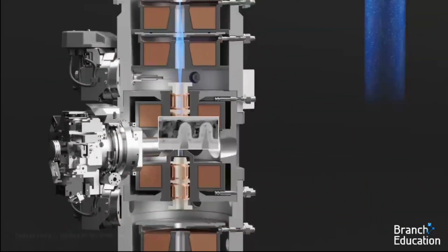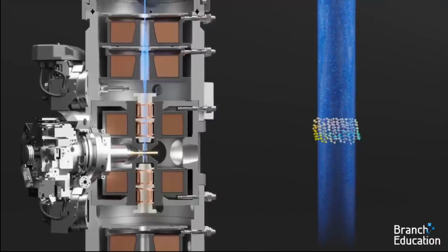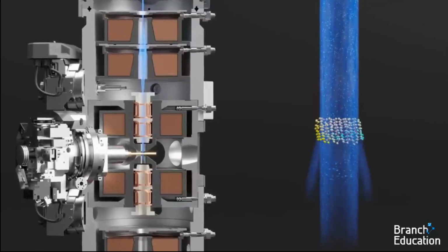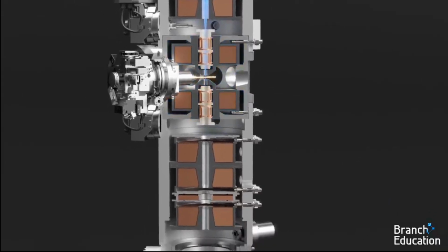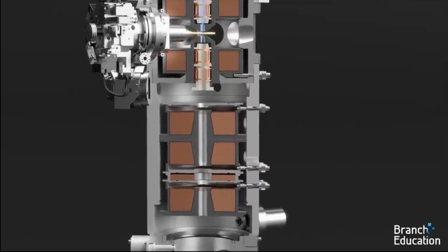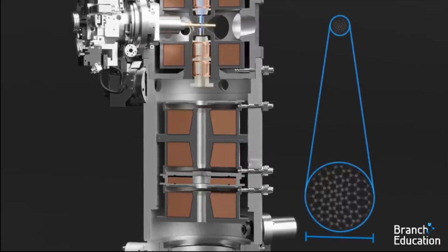The incredibly small beam then hits the specimen composed of different elements and densities of materials, thus scattering the electrons in different ways, thereby imprinting an image on the transmitted electron beam. The next lenses, the objective and a series of 4 projector lenses, are used to resolve and magnify the minuscule image imprinted into the electron beam up to a width of a few centimeters.